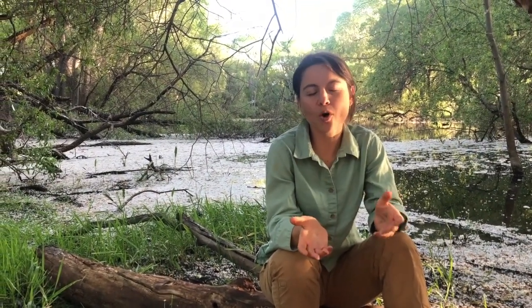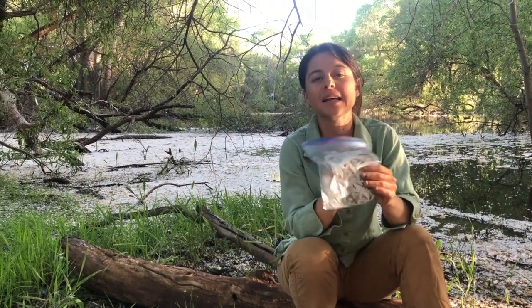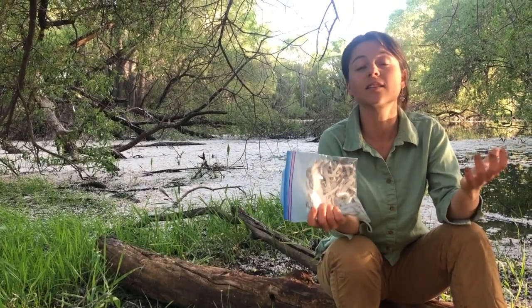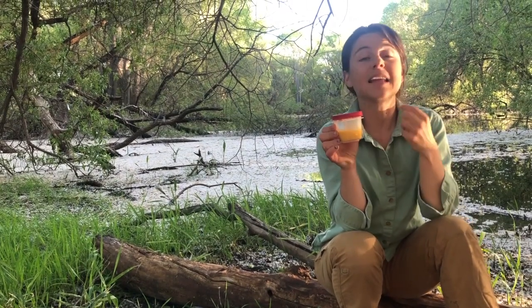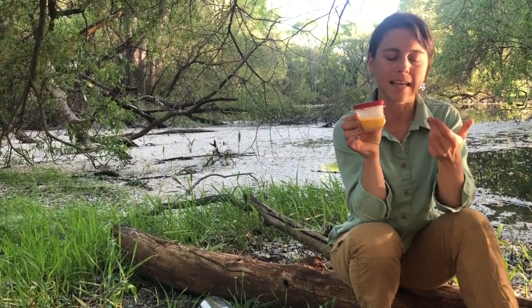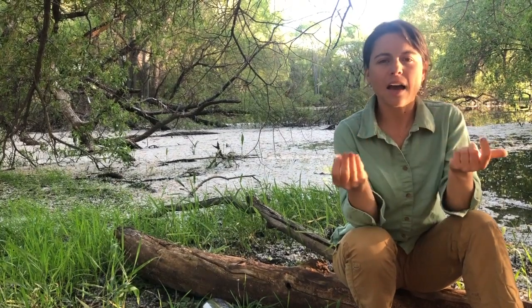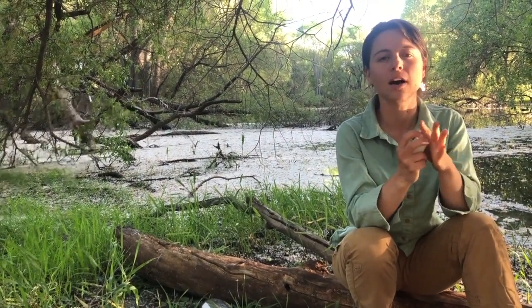So now that we have our mud sample, we're gonna add some things to it to jumpstart the growth of microorganisms. The first thing we'll add is some sort of cellulose or carbon. This is newspaper shreddings, but you can use dry leaves or anything that you know has a lot of carbon in it. Next, we need to add some sort of sulfur. Eggs and egg shells have a lot of sulfur in them, so this is a mixed up egg and I put the eggshells in it. Now this is optional, but you can add some sort of multivitamin crushed up because that's going to have trace amounts of things like magnesium and calcium, which could add some interesting growing to your column.